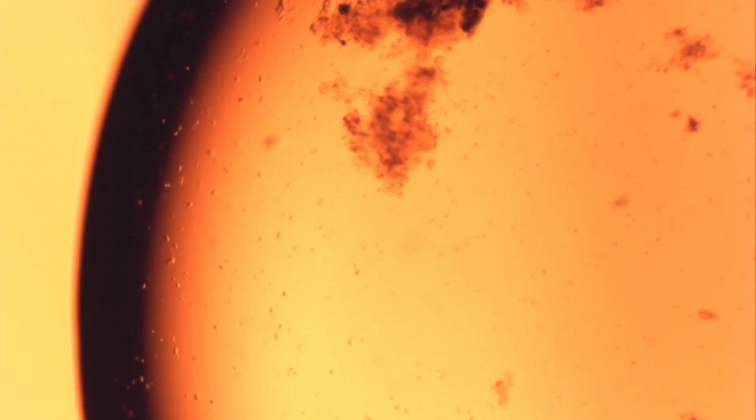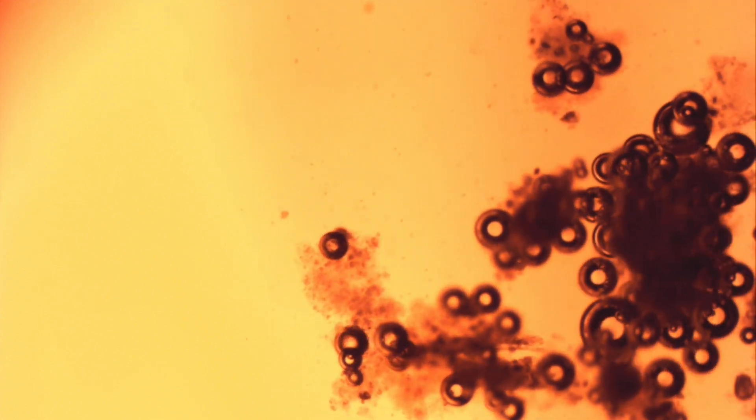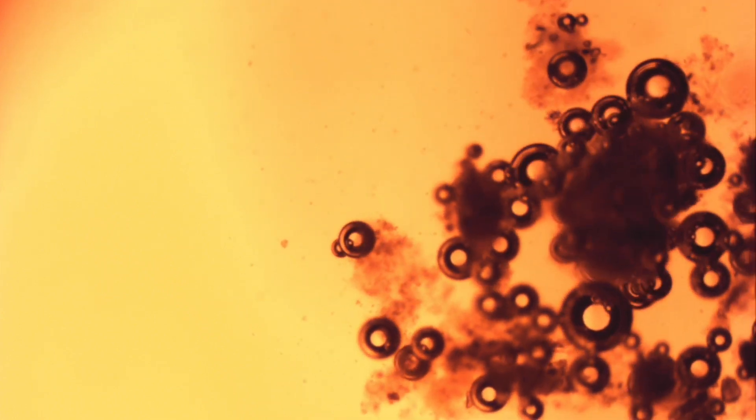Up next is the hydrogen peroxide. I add a small drop to a sample of water. Since the viscosity is very close, it's not as dramatic. But we immediately see most of the protozoa start to quickly disappear, followed by micro bubbles forming around every piece of solid debris.